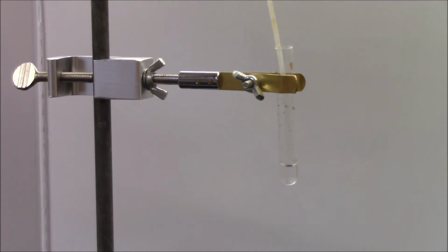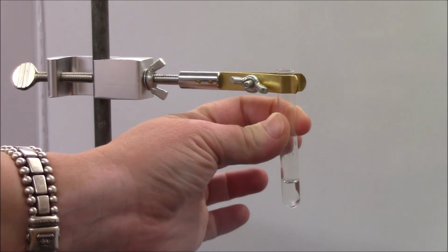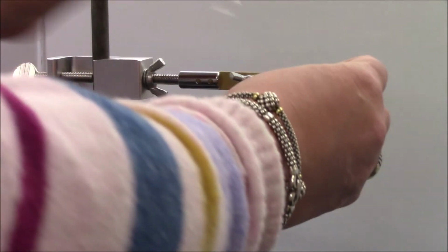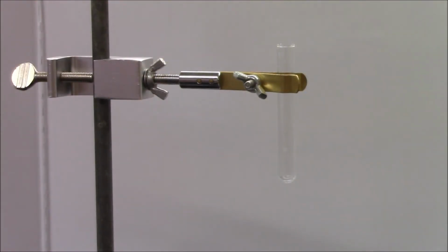I don't understand why a reaction does not happen here. This actually happened before. There is supposed to be a reaction. There is supposed to be a formation of a solid between lead and chlorine, and for whatever reason, you can't see it, but it's supposed to happen. We are going to write down that a solid formed. I don't understand why it doesn't work. I really thought that lead and chlorine... do you have your table of solubilities? Will you check that?